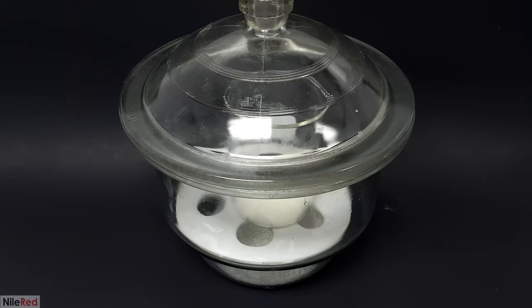When I came back the next day, there were some really nice crystals that had formed at the bottom, and I was kind of sad that I didn't do a time lapse. To separate them off, I just used my vacuum filter again. After the initial liquid had all been pulled through, I washed the beaker and the crystals with some ice-cold water. I left the pump on for several minutes to get rid of as much water as possible, and then I let it dry for about a day or so. The final dry result was a bunch of red, flaky crystals. My yield was kind of terrible though, and I only got 5.8 grams.